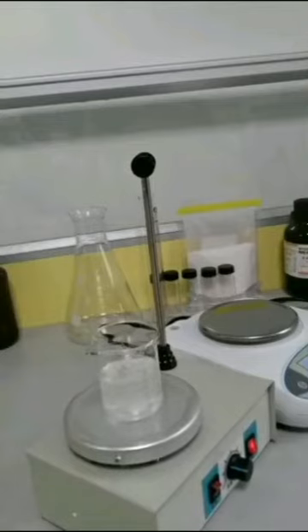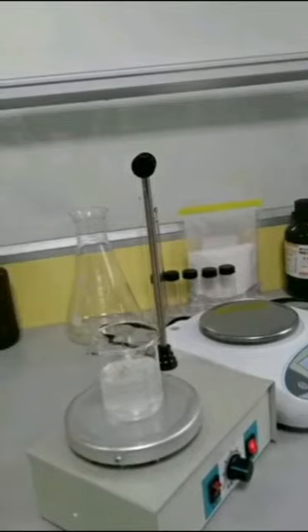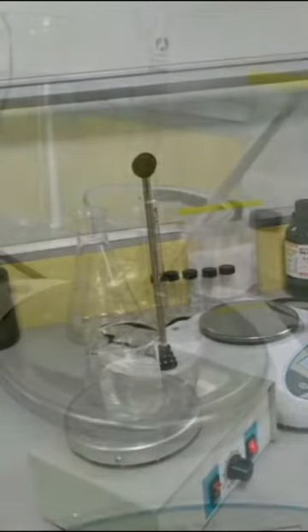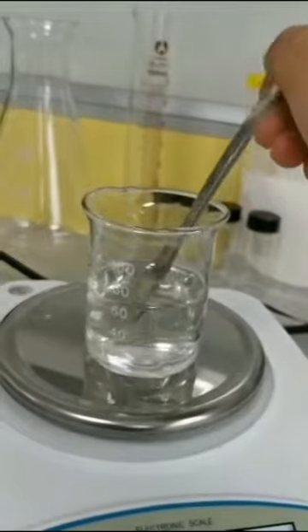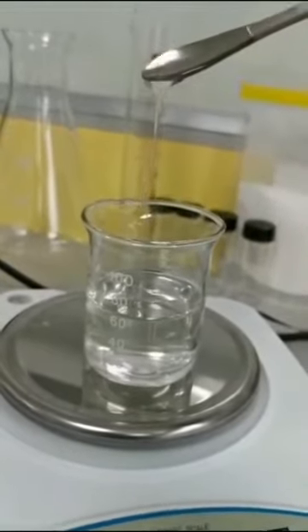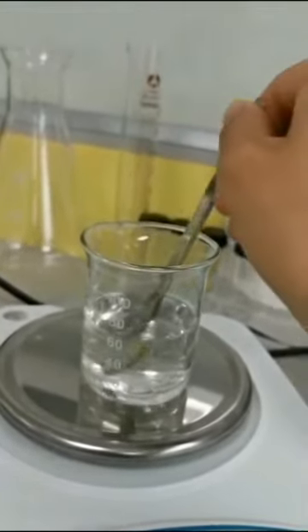Then put it on the magnetic stirrer and stir until the aqueous solution becomes transparent and viscous. This experiment is done.